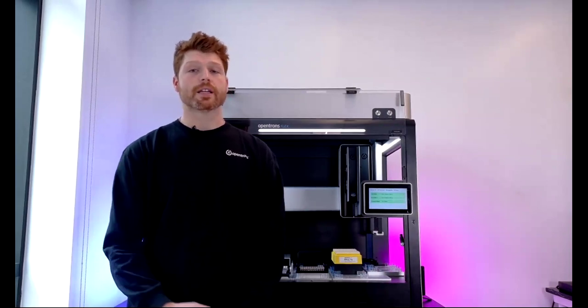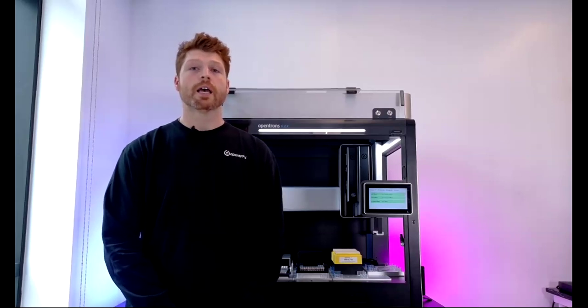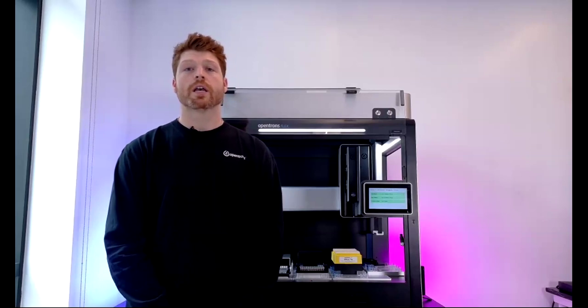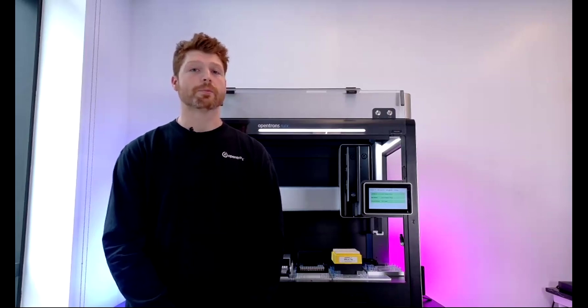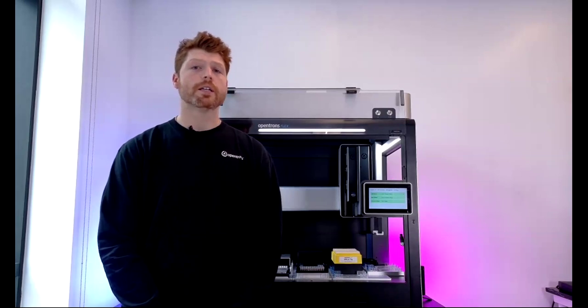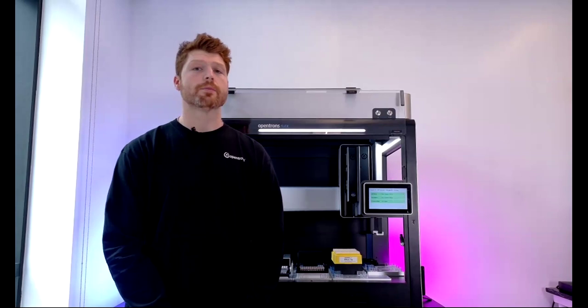First, we'll need to navigate to the protocol library. You can do this through our website, and there you can browse the extensive collection of protocols. Opentrons really is trying to simplify the complexity of these procedures and ensure accuracy and reproducibility for your lab space and the other lab spaces that we are reaching. Additionally, we have a number of verified protocols that our in-house science team or the relevant kit manufacturers have tested, which are then going to be given to you.